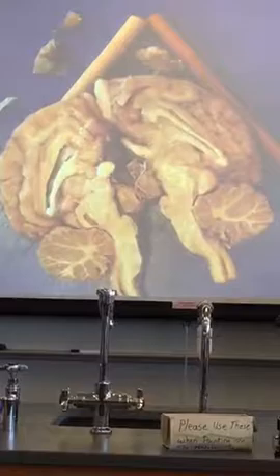We'll do one more cut. Let's get the lobes of the cerebrum. I didn't tell you those. We can't see the insular lobe on a dissection, so we can just skip it. What about the other four lobes we can find?